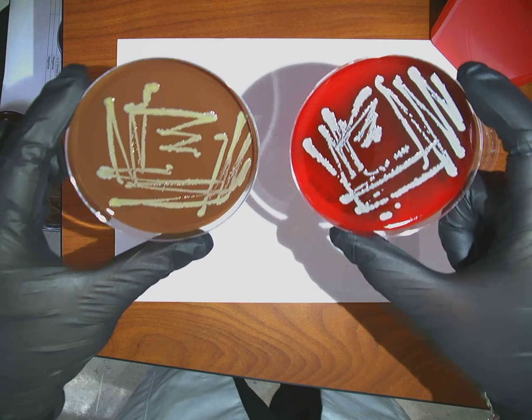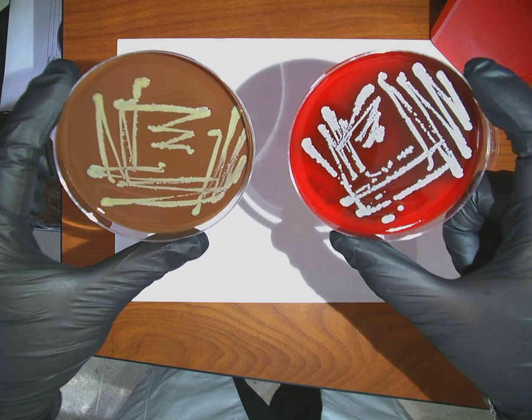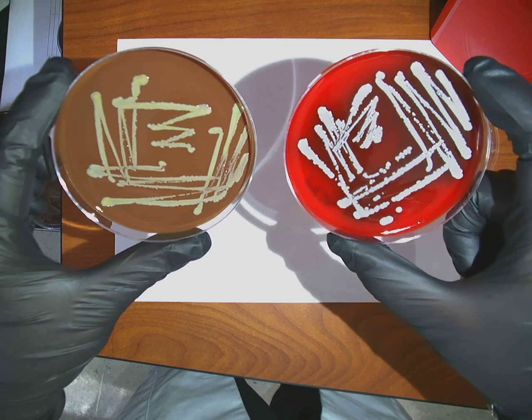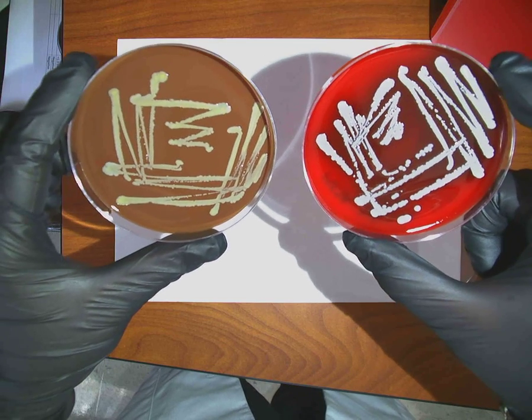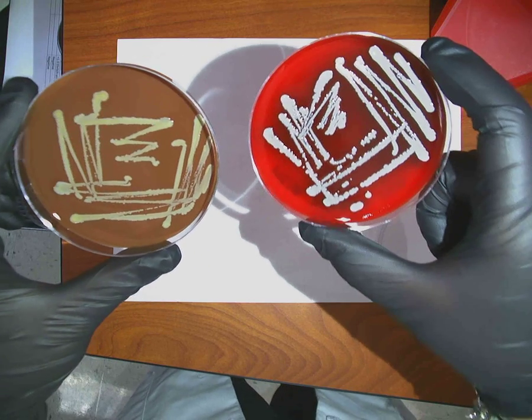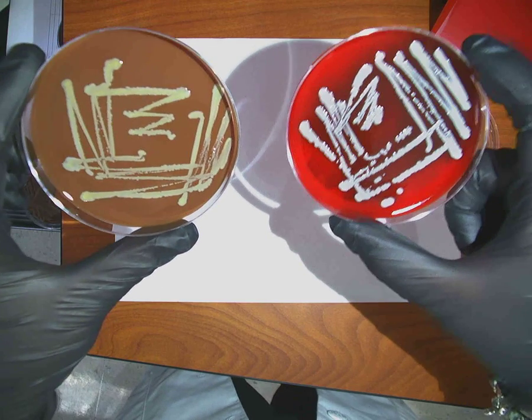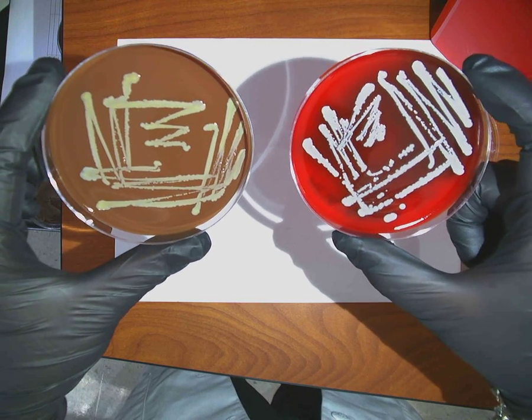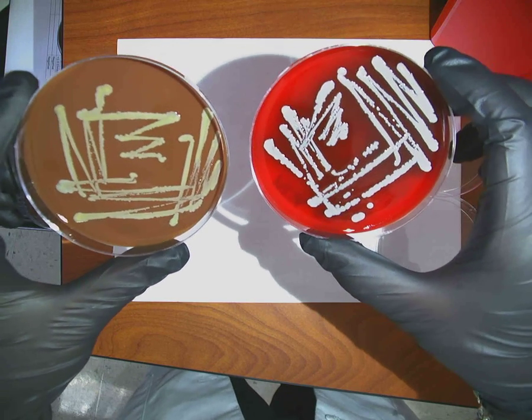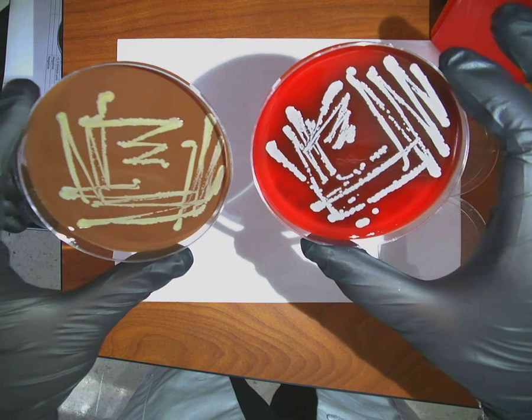So what do you know that it is not? Definitely. It's not strep. What else? It's not Haemophilus because it's growing here. It's not Neisseria. Neisseria is going to be tan, and some people might look at that and see tan, but it's not going to be that bright on blood agar, so you have to look at both of them and compare them. So if it's not Neisseria, it's not going to be Moraxella either. So what does that leave? Staph, okay? So this is staph. It's bright, white to gray, medium to large.